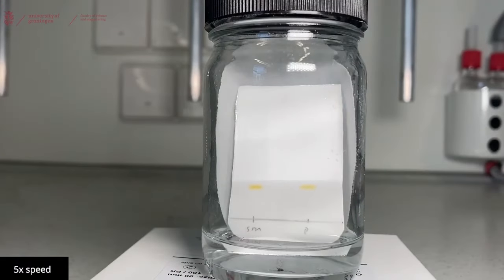Now you will see that the solvent will run up and our different components will have different speeds in the solvent during this. Keep a close eye on your TLC and don't let it run over the top of your TLC plate.